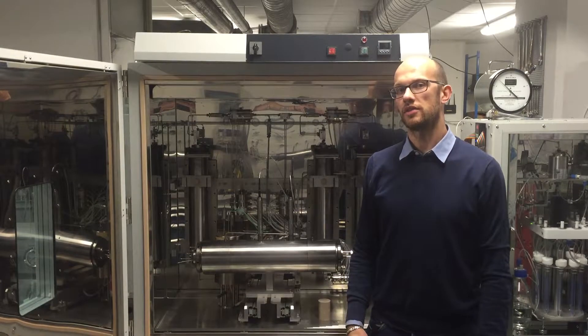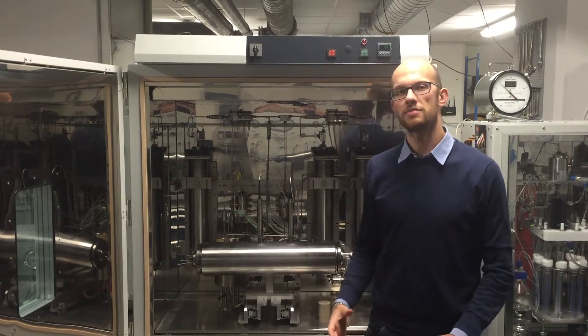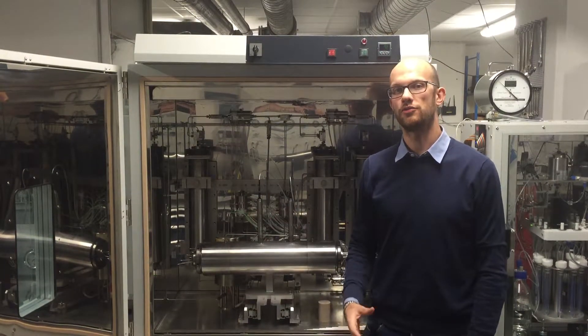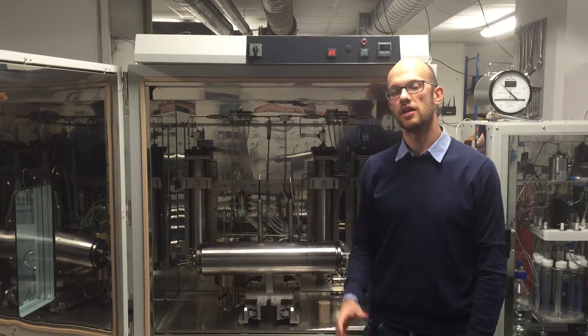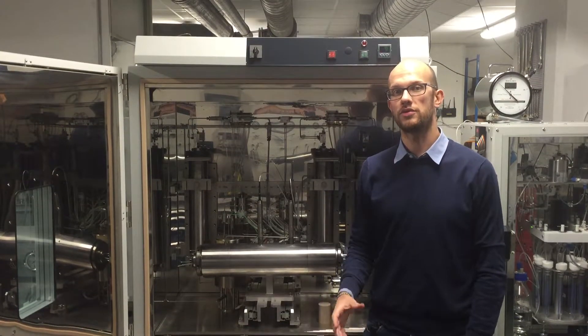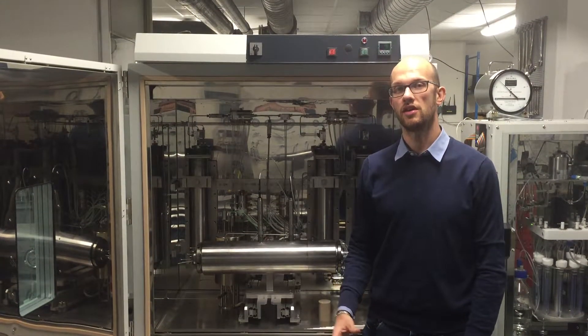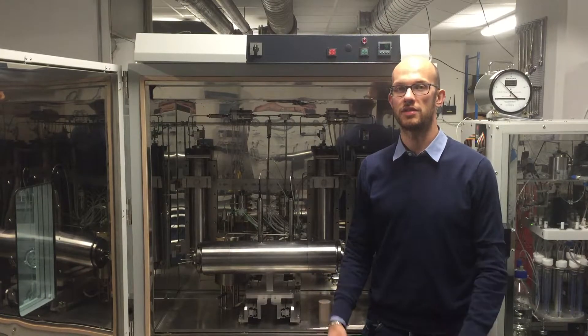The steam flood consists of a main oven. In this main oven, you can have temperatures up to 150 degrees Celsius. If you couple that with the maximum pressure of 10,000 psi, you have a broad range of possible experiments.